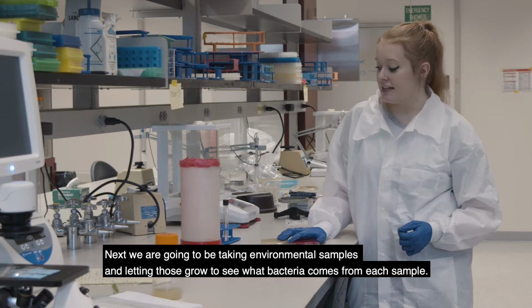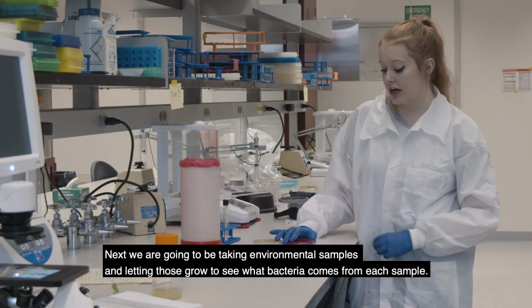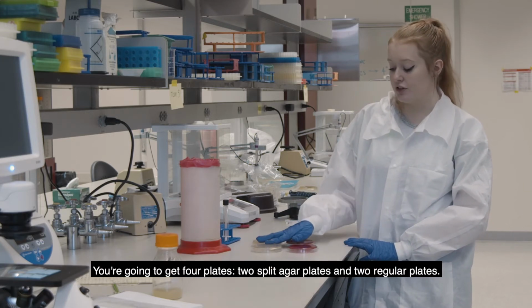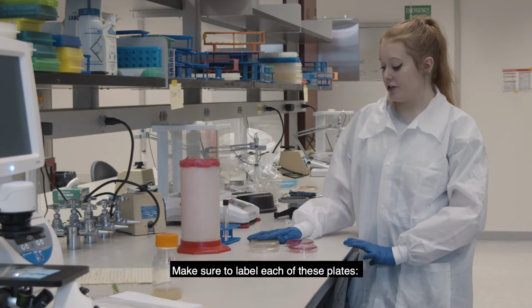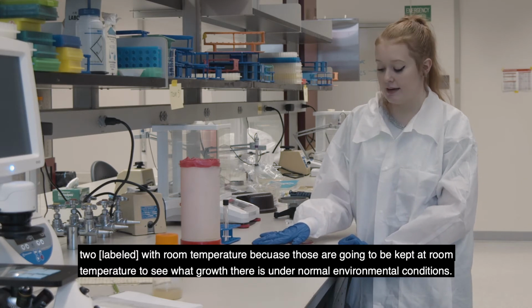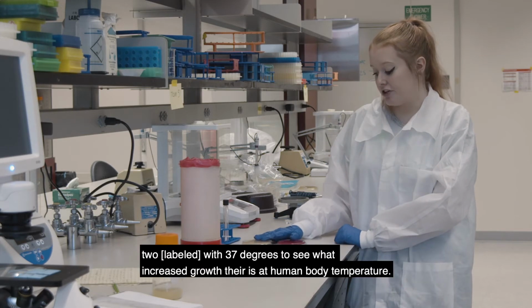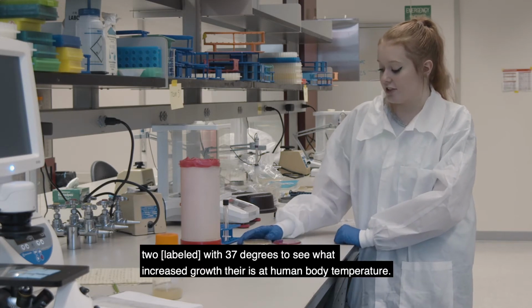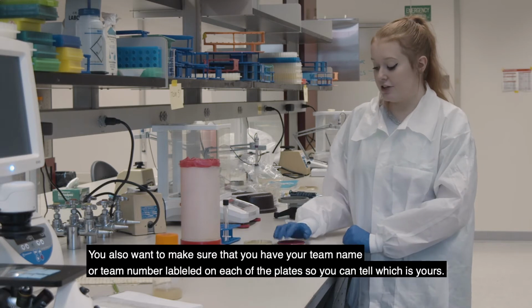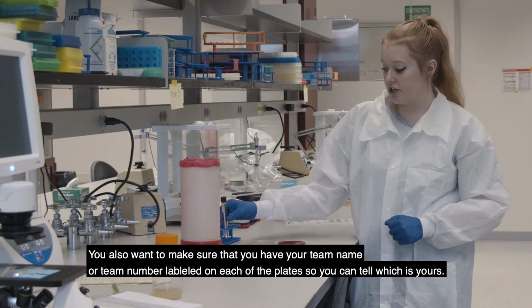So next we're going to be taking environmental samples and letting those grow to see what bacteria comes from each sample. So you're going to get 4 plates, 2 split agar plates and 2 regular plates. And you want to make sure that you label each of these plates, 2 with room temperature, because those are going to be kept at room temperature to see what growth there is under normal environmental conditions, and then 2 labeled with 37 degrees to see what increased growth there is at human body temperature. And you also want to make sure that you have your team name or team number labeled on each of the plates so you can tell which is yours.